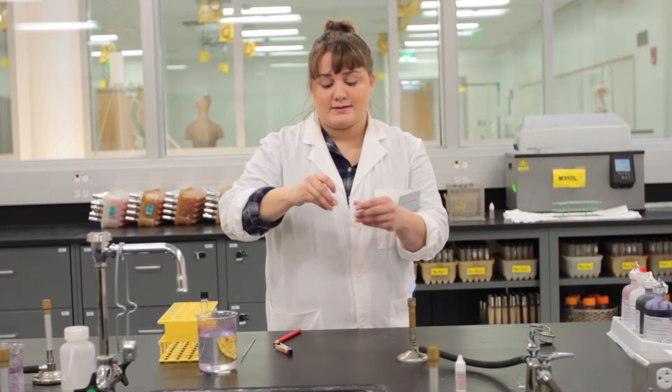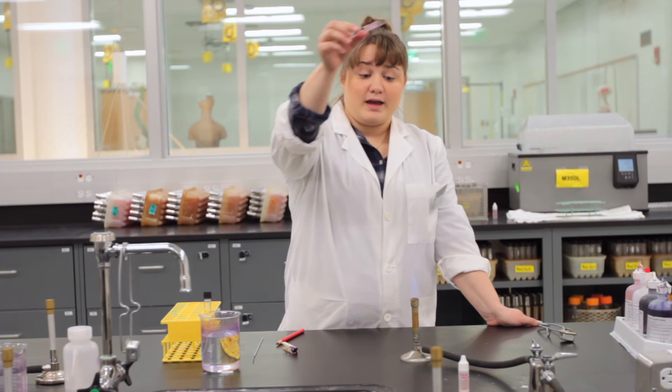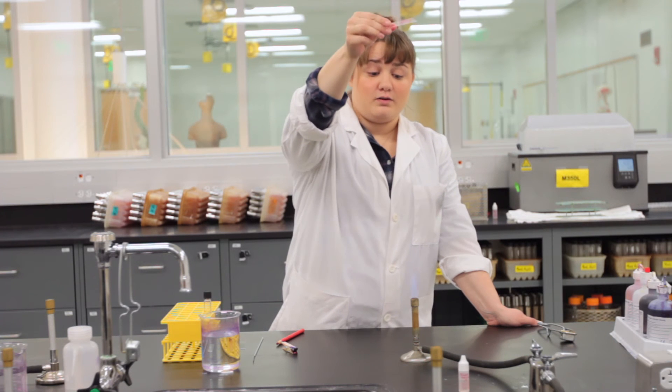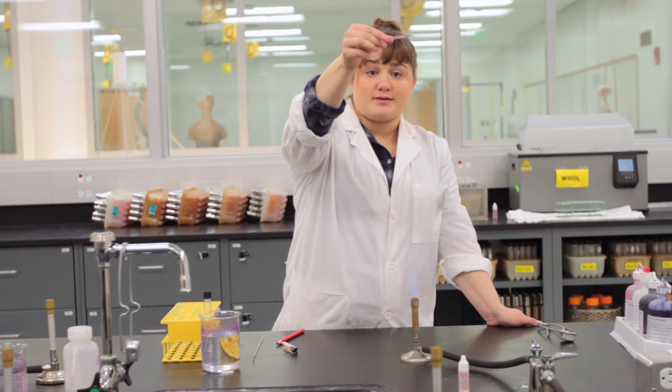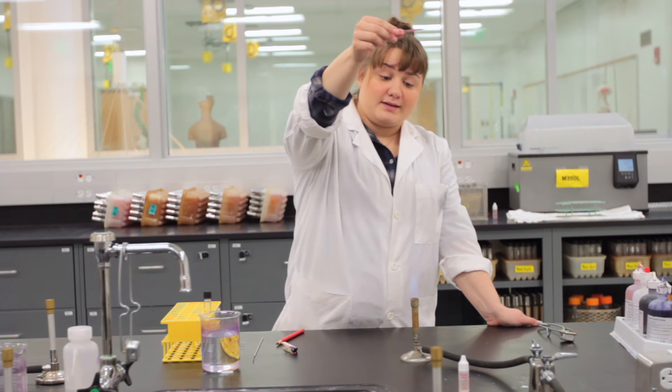Now we are going to take the slide and dry it. One of the ways that we dry our slide is going over the flame. If the slide gets too warm for your fingers, it is going to be too warm for the bacteria, so keep that in mind while you are holding the slide over the flame.